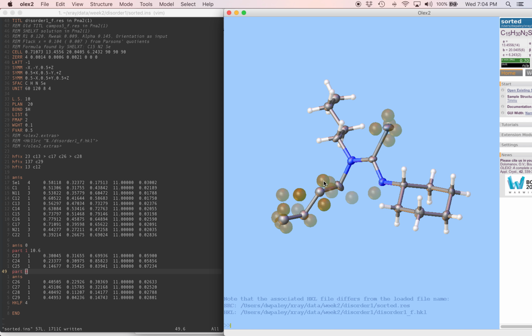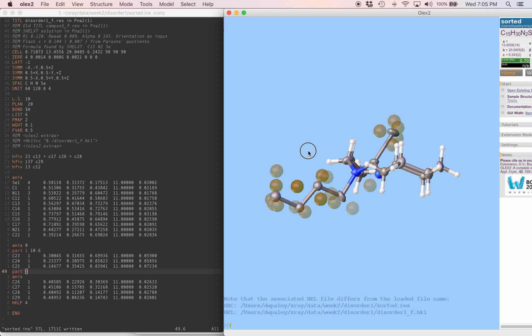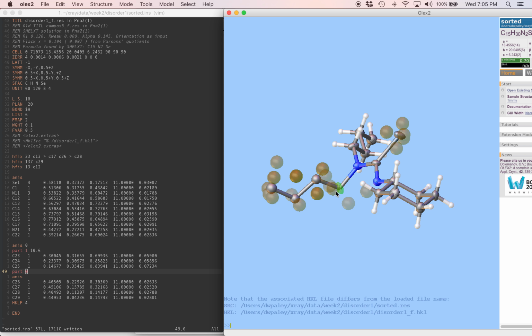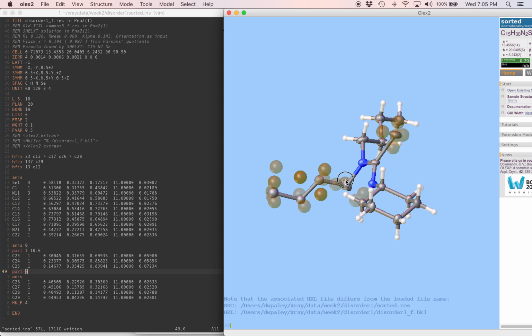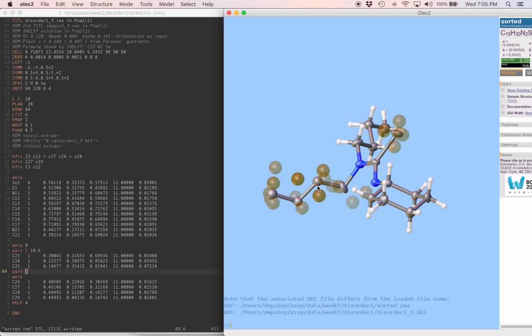There's one more difference feature here. We could wonder if this is the second disordered position of carbon 23, but this other one, first of all, it's a stronger difference feature. It's 1.9 electrons compared to 1.3. Second of all, the conformation here just looks more realistic to me compared to this other one. So we'll go with the stronger difference feature for now, and if it turns out that we need to worry about this later on, maybe we'll worry about it. But for now, we're going to put in a second position of carbons 23, 24, 25, and we're going to use these 3 Q peaks that I picked out.